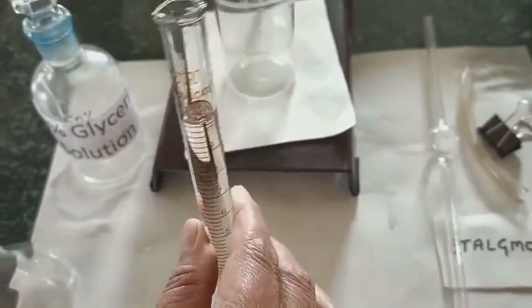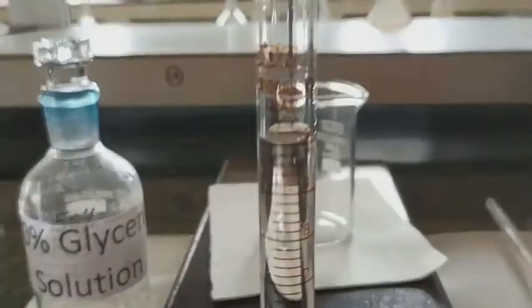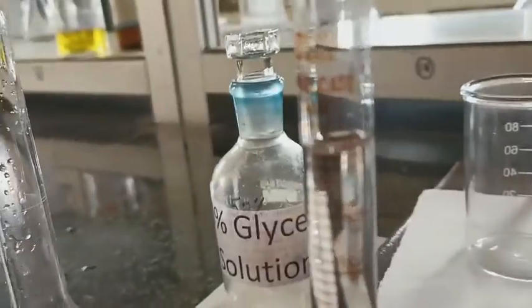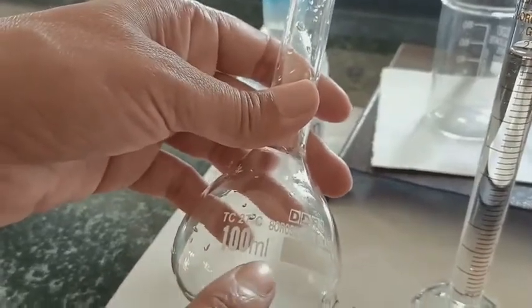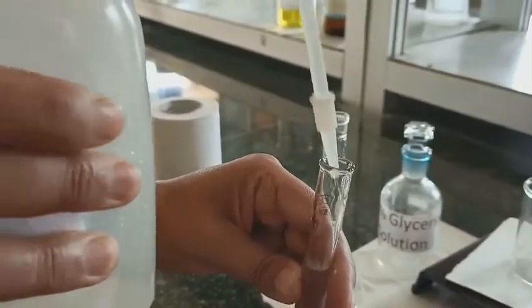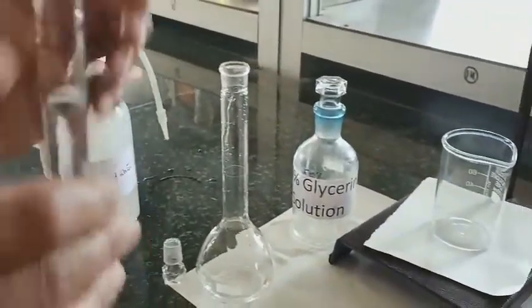First I will show you how to prepare the 10% glycerine solution. In this measuring cylinder, fill up to 10 ml. You can see the lower meniscus — this lower meniscus is an application of surface tension due to cohesive forces. I will pour this 10 ml into a 100 ml flask and wash it thoroughly with the solvent, which is water here.